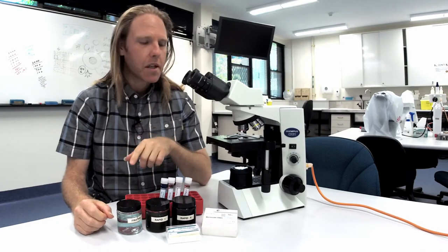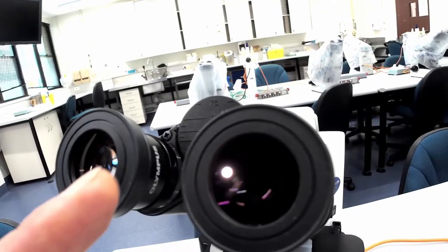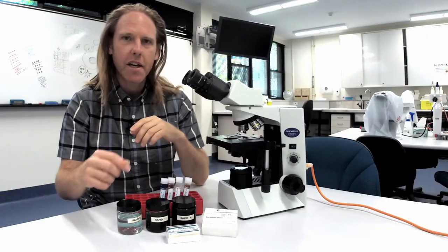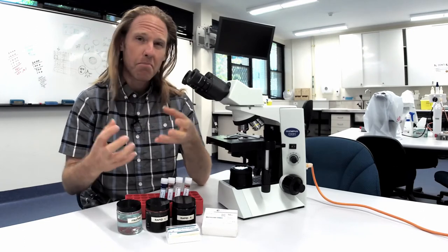The most common problems we see are slides left on the stage while they're still dirty with the light on and incorrectly adjusted eyepieces and aperture. All of these add up to give you a dirty scope and poor image quality.